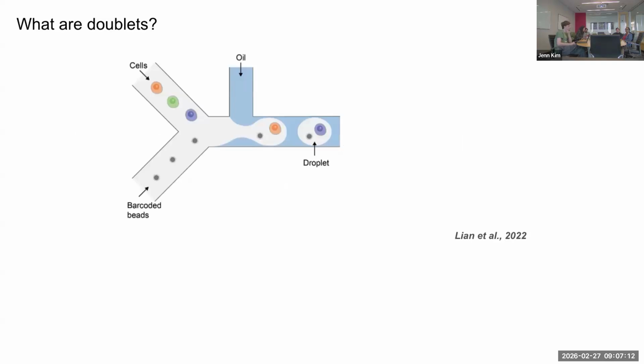So topic of the day, what are doublets? So droplet-based sequencing such as DropSeq or 10x Genomics Chromium uses microfluidic technology to isolate single cells or single nuclei and uniquely barcoded beads into these nanoliter-sized lipid oil droplets, which contain a buffer with all the necessary enzymes and reagents for cell lysis and hybridization of these barcodes to the mRNA fragments. So each of these droplets acts as a separate reaction chamber, and you get doublets when you have more than one cell in one of these droplets.